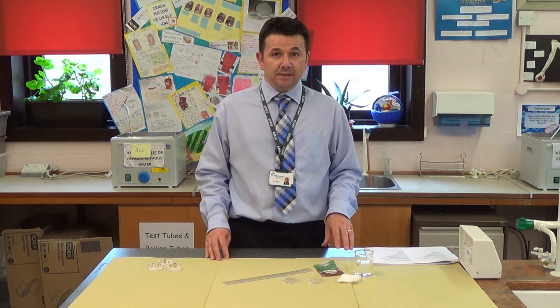Welcome to GCSE Biology Required Practical Activity 8. We're looking at the effects of the intensity of light on cress seeds.